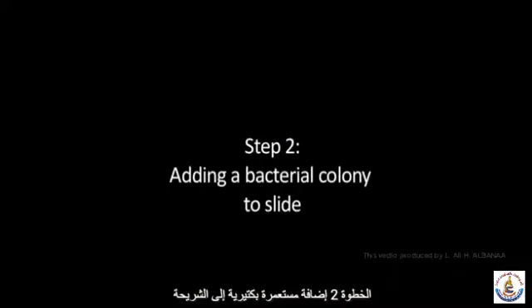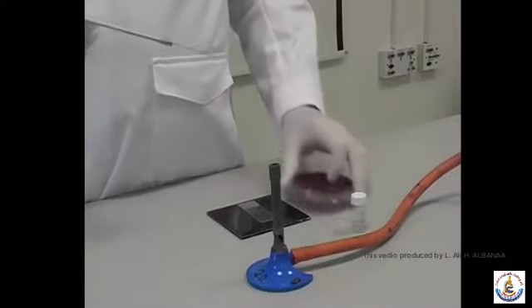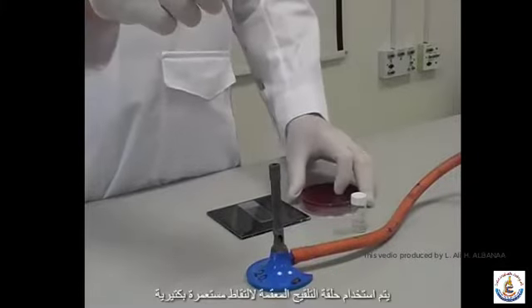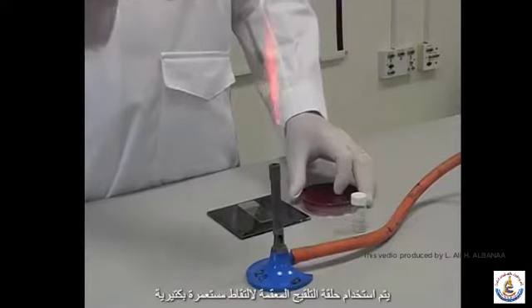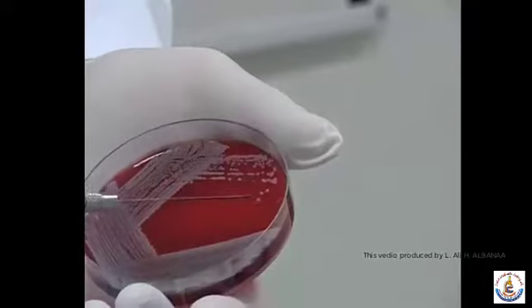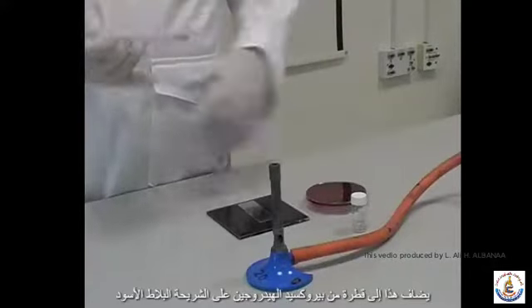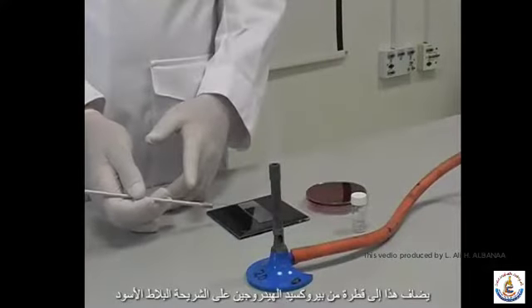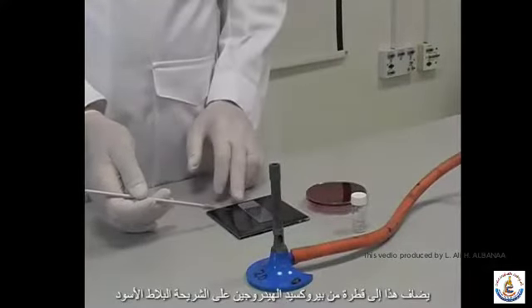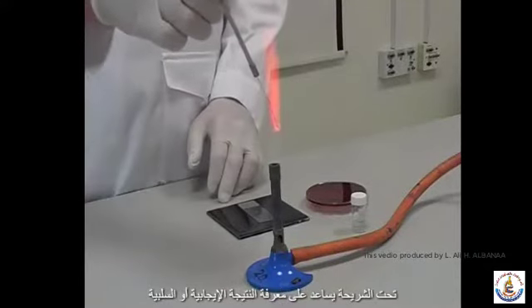Step 2. Adding a bacterial colony to the slide. A sterile inoculating loop is used to pick up a bacterial colony from an agar plate. This is added to the drop of hydrogen peroxide on the slide. The black tile under the slide helps to see whether the result is positive or negative.